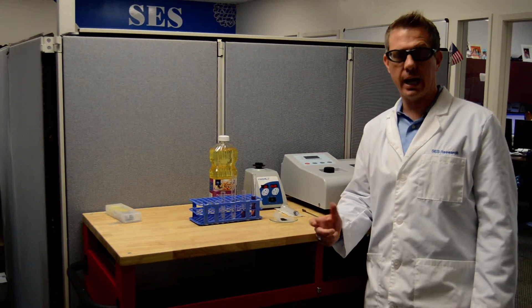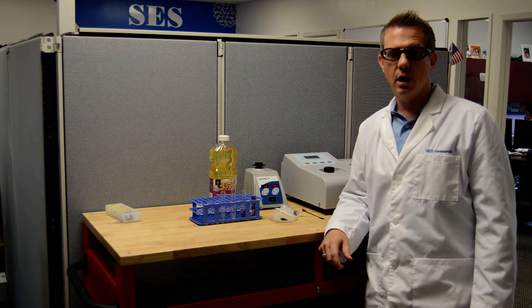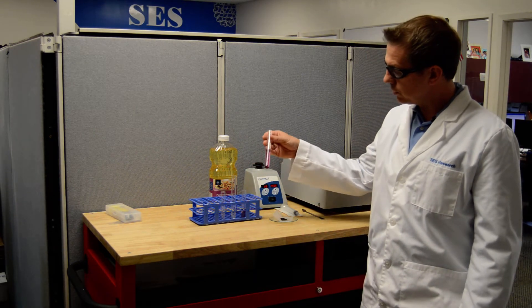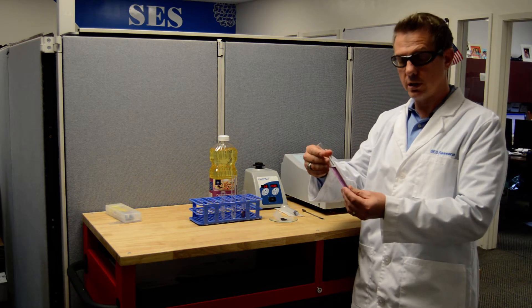In that demonstration we actually filtered product C-60 and what we filtered came out clear. In that demonstration I also showed a test tube similar to this.